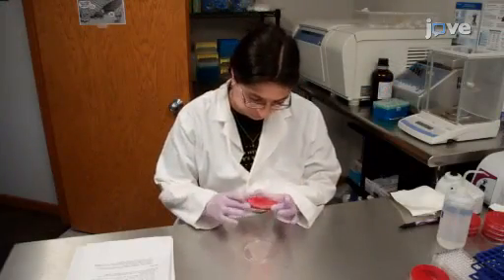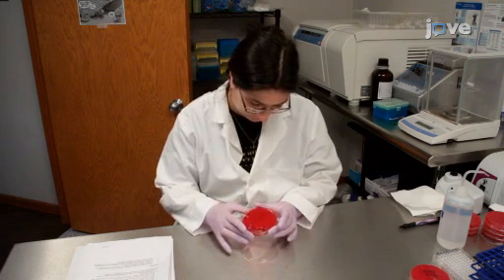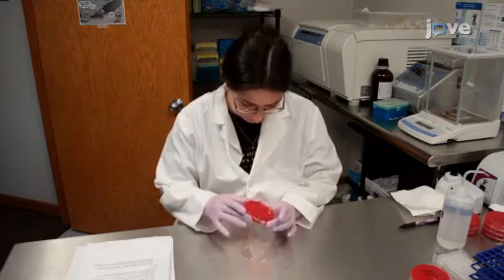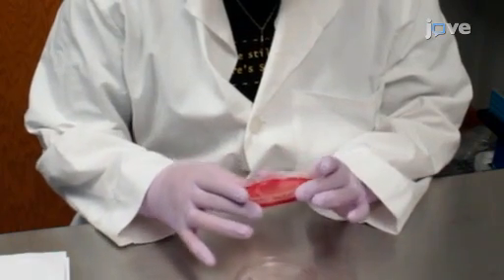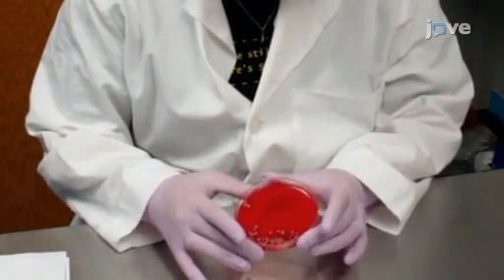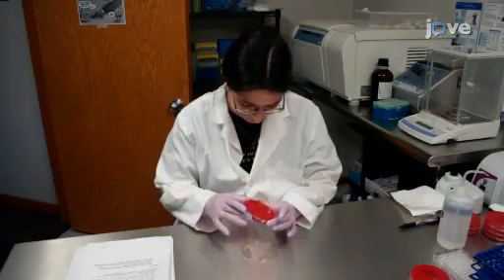Finally, check the purity plate. If all colonies are similar to the colonies used as inoculum, then it can be considered pure. If there are any other colonies present, then there is potential for a contaminant to be present in the MIC panel, and the test should be repeated.